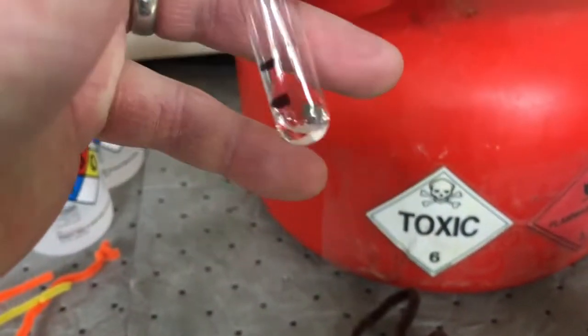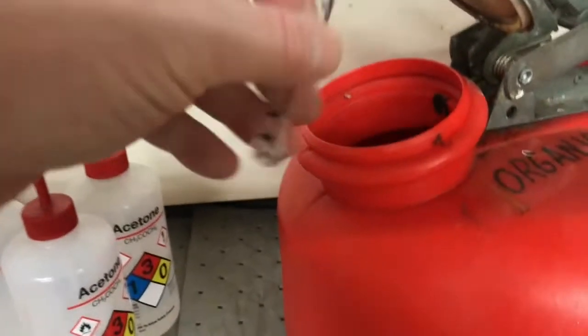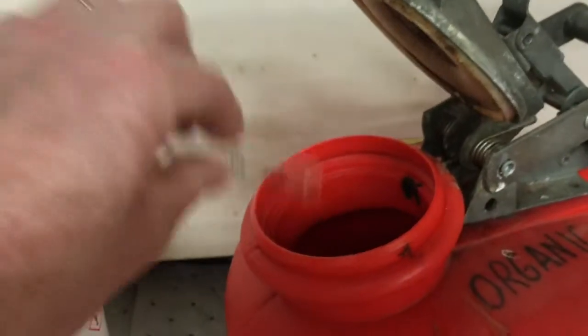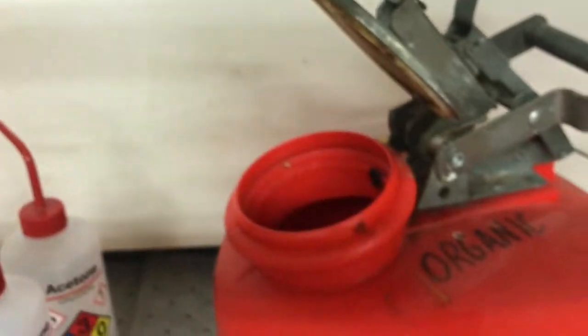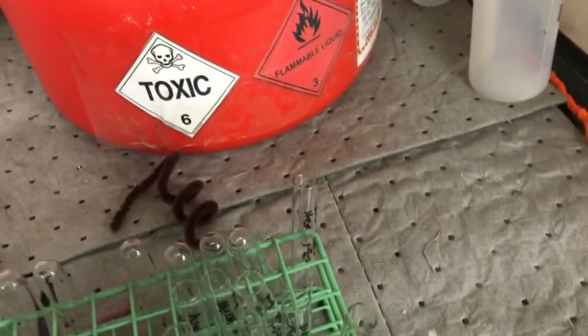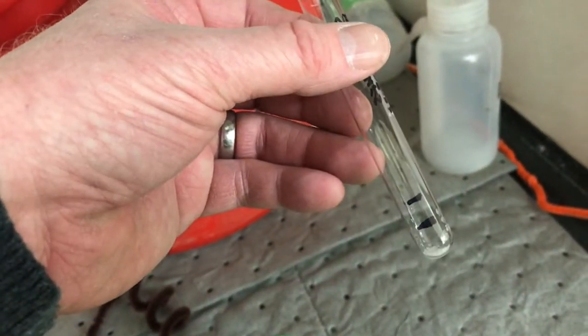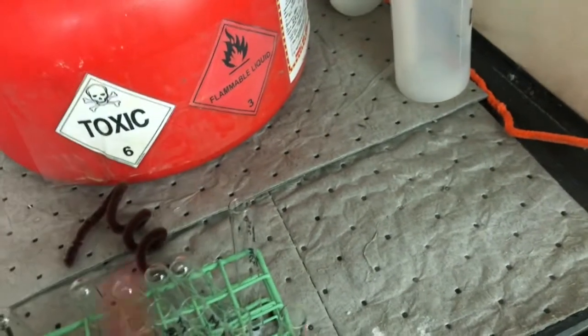I'll just take my solution. This one's the succinic acid and hexanes, and I'll pour that into the waste bottle. A lot of my succinic acid might still be stuck at the bottom of this. See, there it is, yeah. What we use to try to get that out is, well, actually succinic acid can go down the sink drain, so I could just let this sit and evaporate the rest of the hexanes, maybe until the next lab period. But if I'm in a rush, maybe I should do something else.